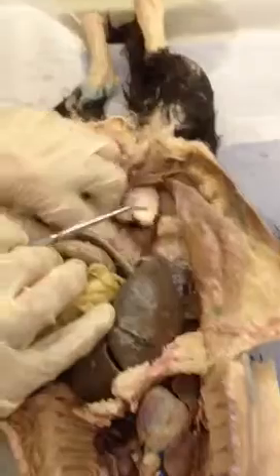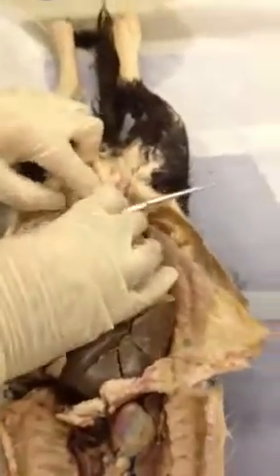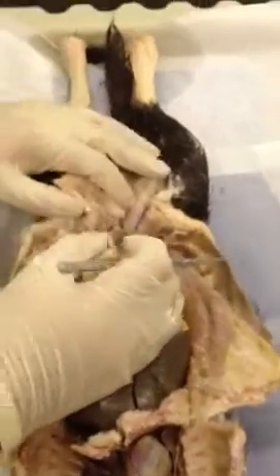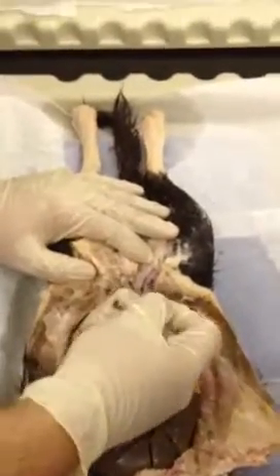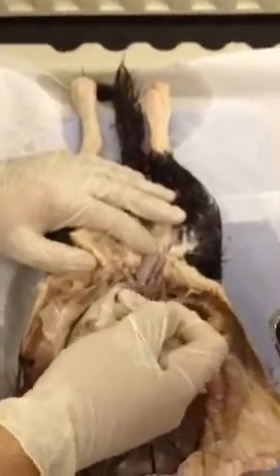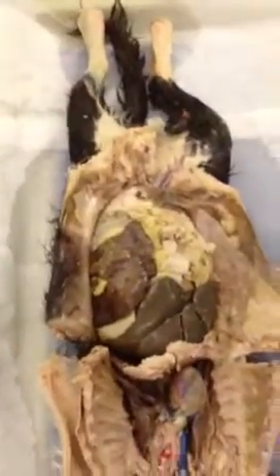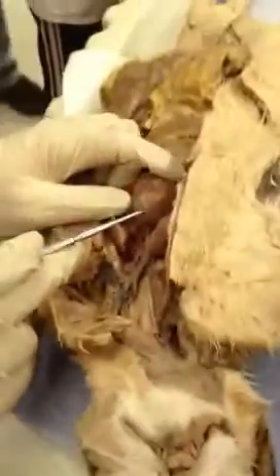And we can appreciate that coming in here. And then we get in. Now we lose it kind of here for a little while around the pelvic region, but we pick it up again in the leg, and this is going to be called the femoral, right? And good enough on this cat. We're not going to get much more out of him. So let's take a look at this cat. All right. So this again.